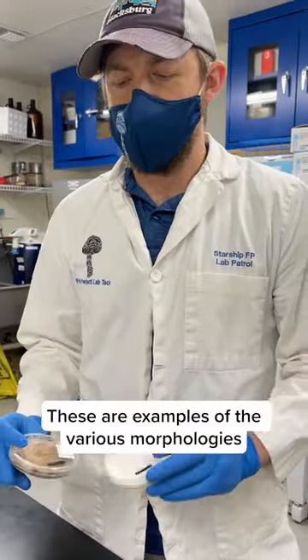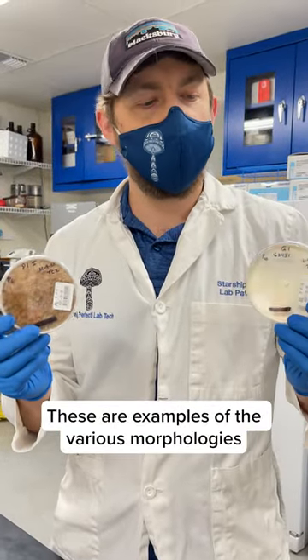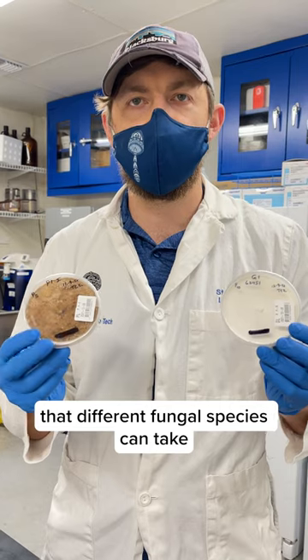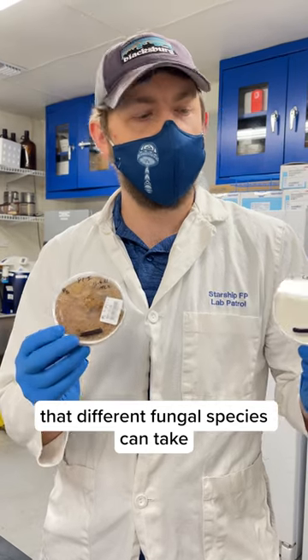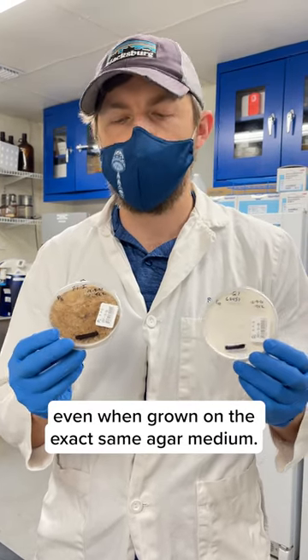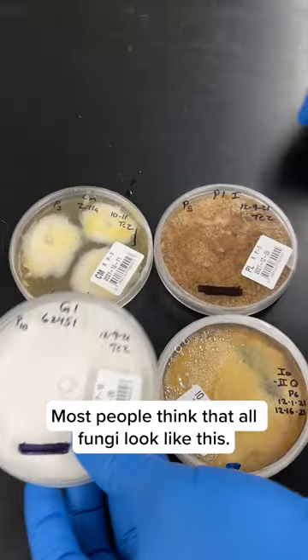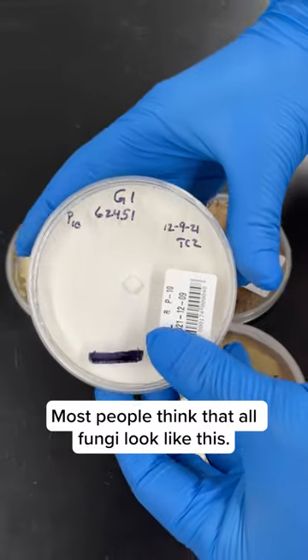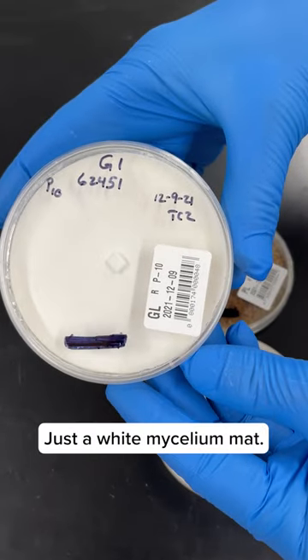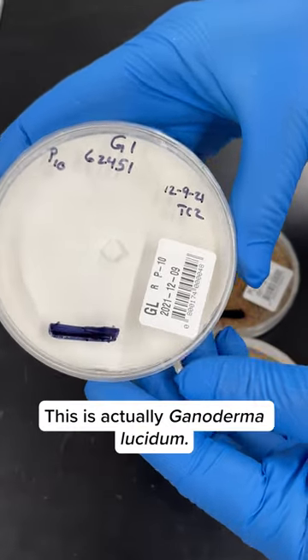These are examples of the various morphologies that different fungal species can take, even when grown on the exact same agar medium. Most people think that all fungi look like this — just a white mycelium mat.